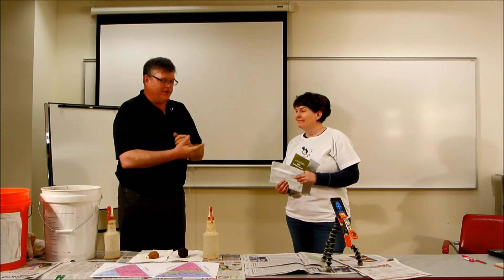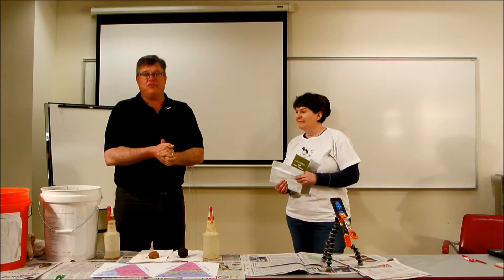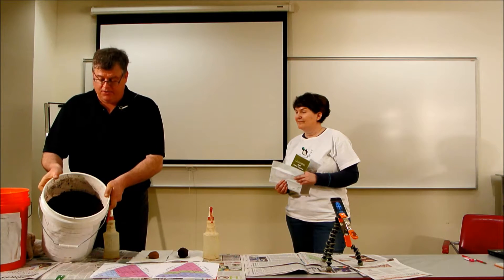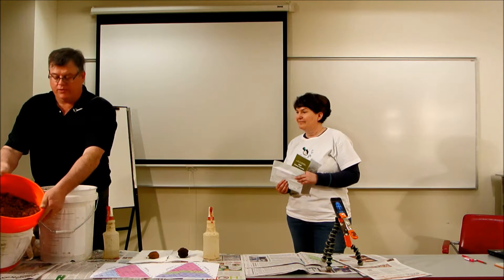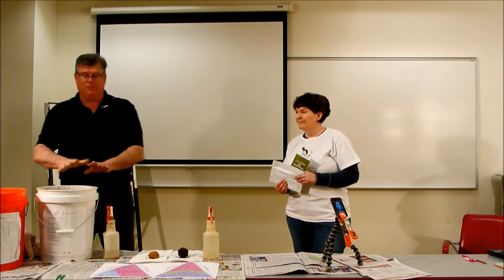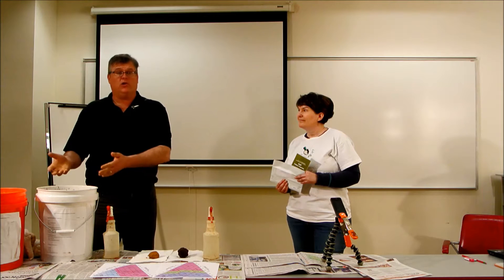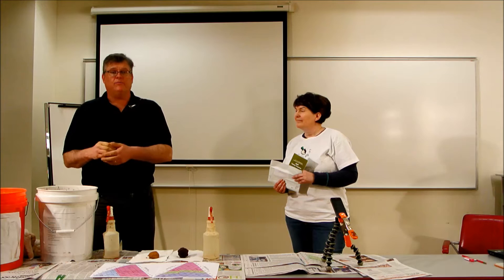Sally is going to be discussing where you can go and get your own supplies to do this exact demonstration on your own. You'll notice that we have two soil samples here — a topsoil and a subsoil. They're from two different soil types and they're kept moist in a five-gallon bucket. I sieved out the larger rock fragments, but you don't need to do that. If you wanted to collect your own, you could go into your garden and collect them.